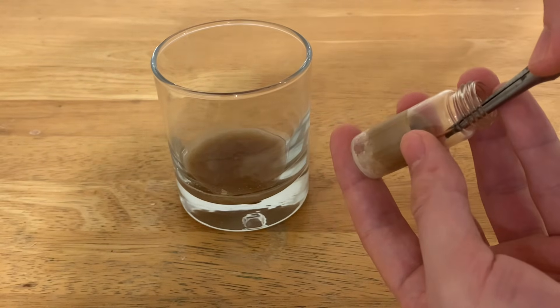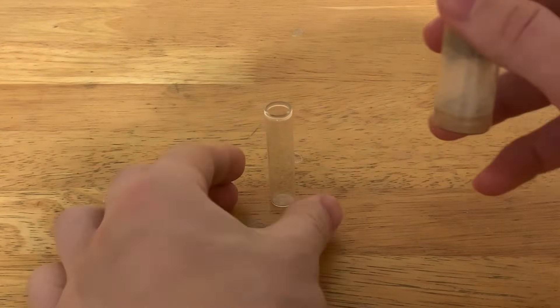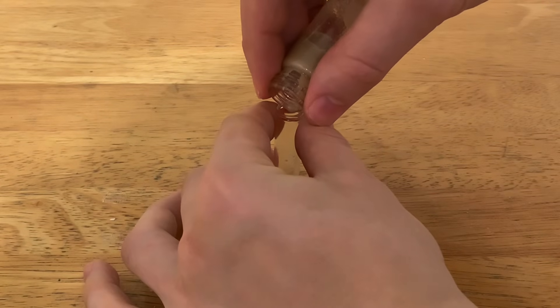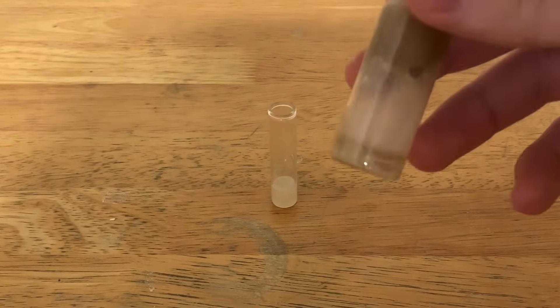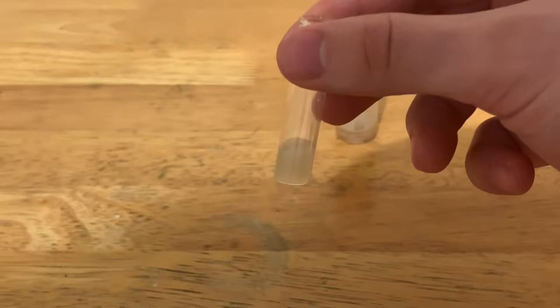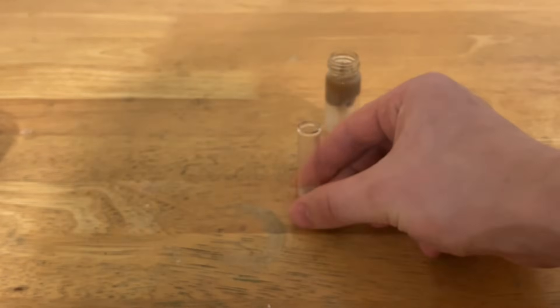Now I'm just going to get the copper mesh out and pull all the coconut oil out with it. Now that I've made an opening, I'm going to pour the liquid out of here — the solids will remain inside while the liquid glycerine leaks right out. And this is the result: I got a murky, white-looking liquid, nice and full of impurities and all of the salt and contaminations in the world. This should theoretically be glycerine. And that's it for this video — see you guys.